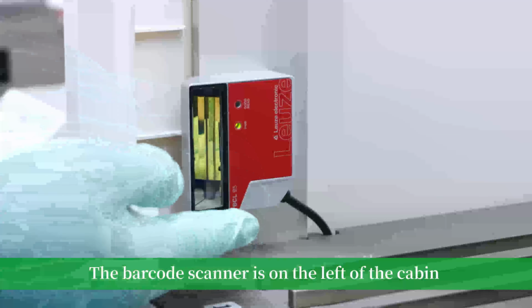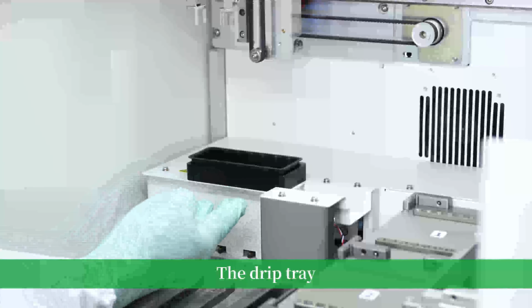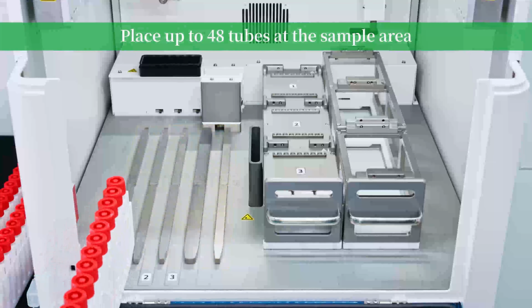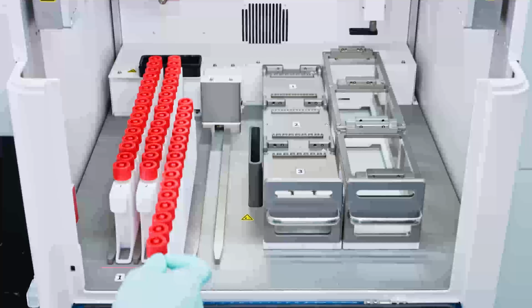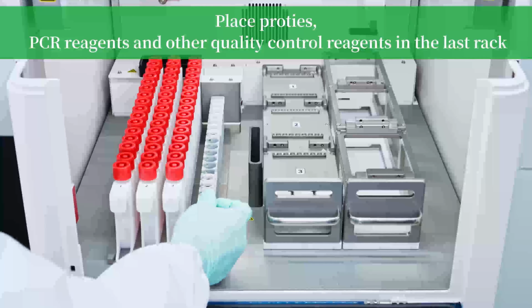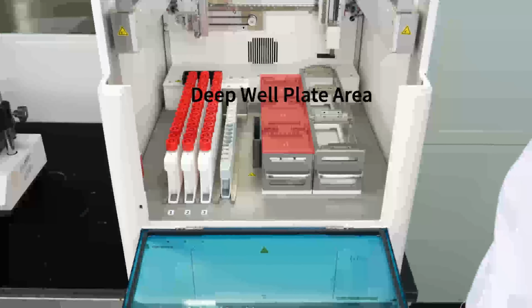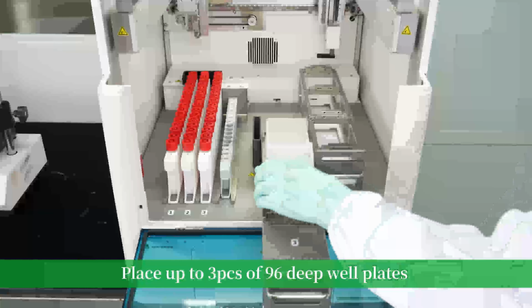The barcode scanner is on the left of the cabin. The drip tray prevents contamination from cap drip. Place up to 48 tubes at the sample area. Place protease, PCR reagents, and other quality control reagents in the last rack. Place up to 3 pieces of 96 deep well plates.